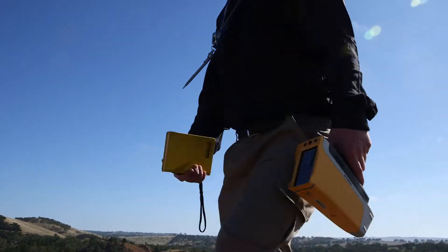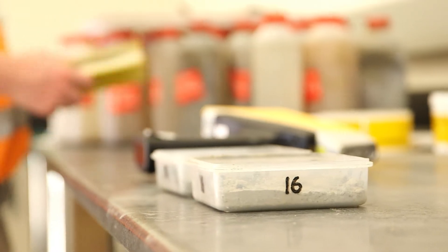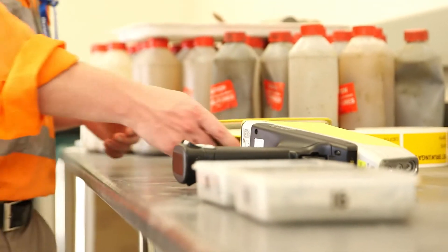Our customers are starting to generate their own chemistry on their samples, so they need to take responsibility for the integrity of that data. Users that frequently send samples to the lab are likely to already have an established QA/QC procedure, so some aspects of this video may not be entirely new to them. However, they will pick up on some unique aspects of handheld XRF. My customers always ask what QA/QC they should do, and I always reply: why not replicate what you're doing for the lab? That way they create uniformity, standardize their protocols, and on a basic level, it's just easier to remember.